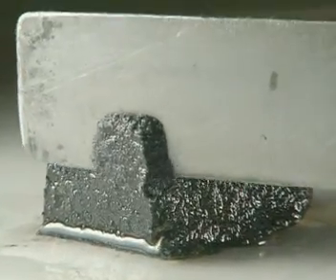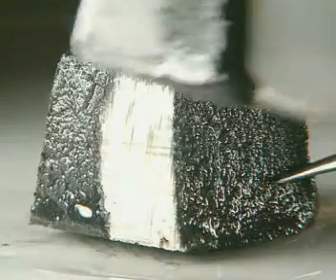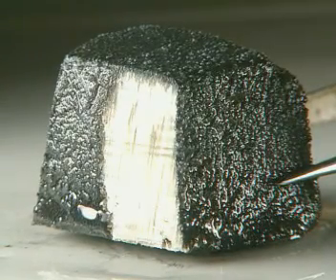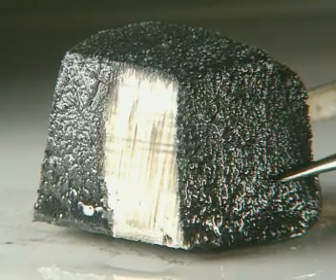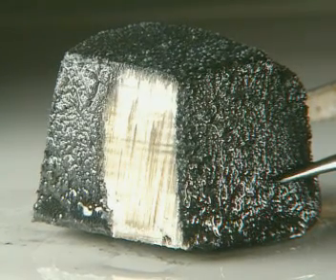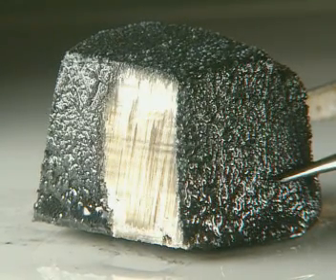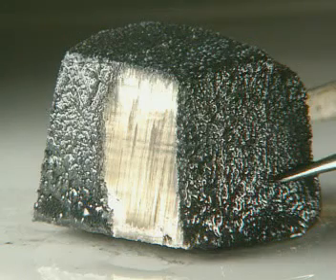Lithium is so soft it can be cut with a knife. You can see how shiny the freshly cut surface is. But leave it exposed to the air for a few seconds and it quickly begins to tarnish. It's reacting with the air.